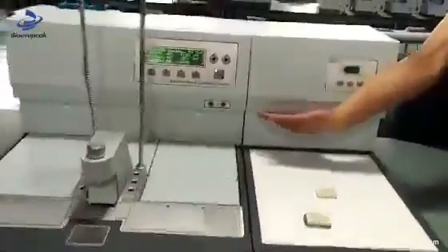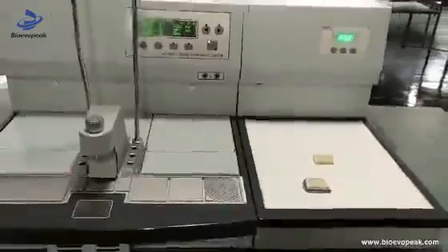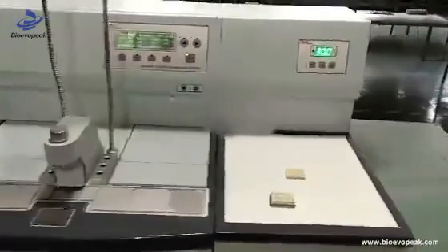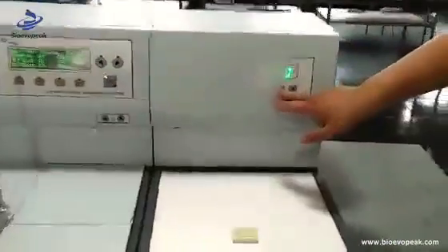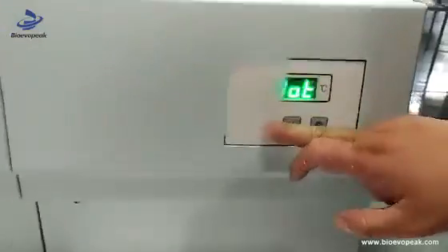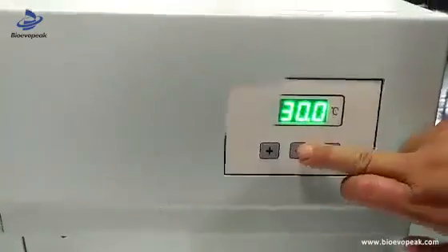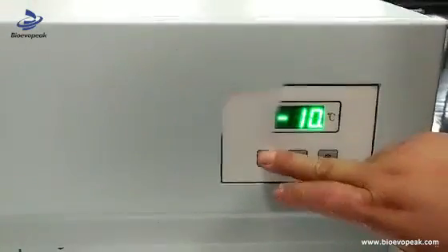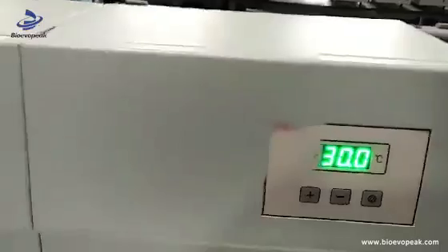Turn on the switch for the cooling system. Adjust the temperature for the cooling system by pressing the minus and increase keys, then the set key. Normally we set the temperature to minus 10 to 12 degrees centigrade. Then press the set key to confirm it. Finally, the machine can make cooling itself.